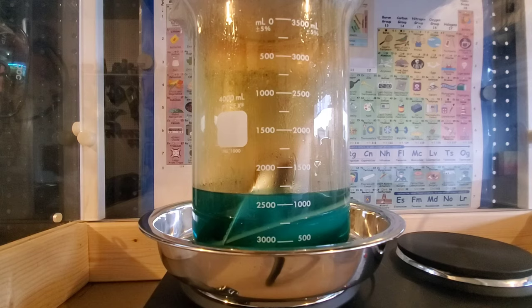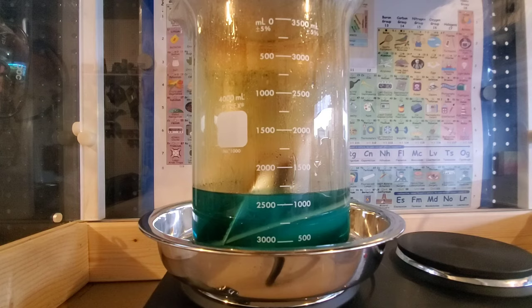All right. The current elapsed time is about 1 hour and 50 minutes. The reaction has slowed down a little bit. So I'm going to go ahead and add some additional diluted nitric acid.